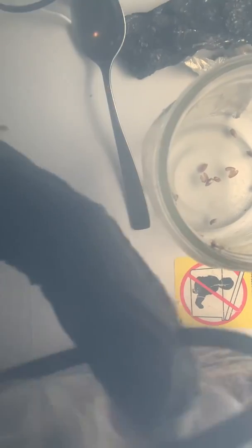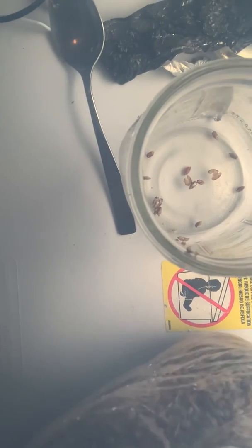I'm using the whole jar here — sometimes I use half a jar per bag, but I've got a lot of this shiitake. So I'm going to use a full jar and then couple it up to the top. You want to make sure that the air filter is visible so you have airflow for the colonization period. Take your zip tie to get around it, make sure you leave your air filter, and close it up.